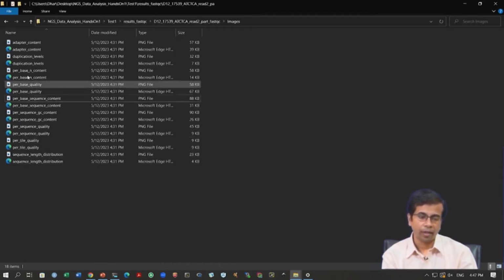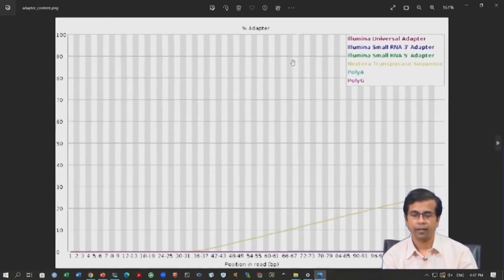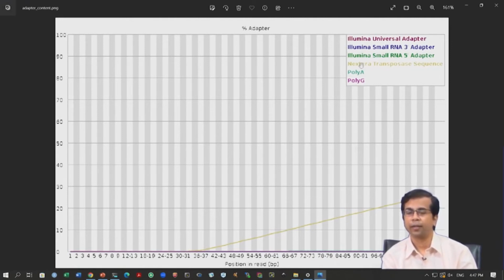Okay. But then we also need to check the adapter content, right, and here again we see a very similar pattern, right. We see again we have many reads that contain adapter sequences, okay, and a similar observation, we have this Nextera transposase sequence, right. So, this kind of helps us in evaluating the data, right.